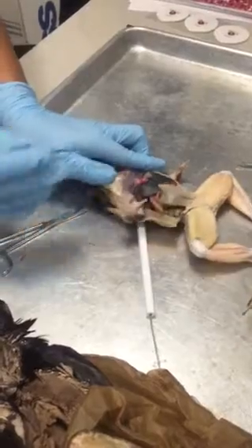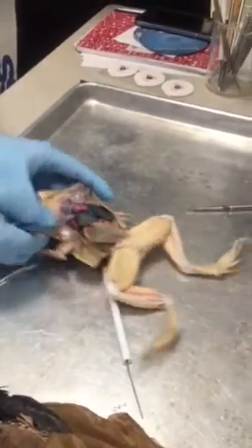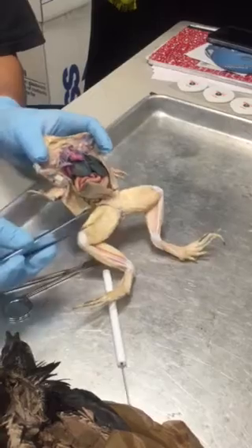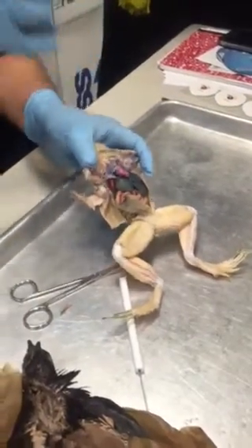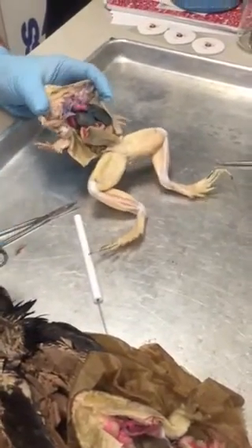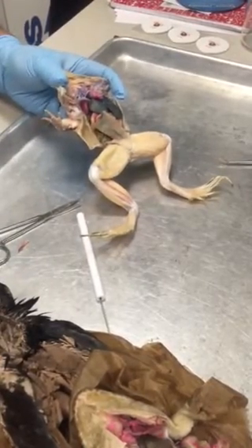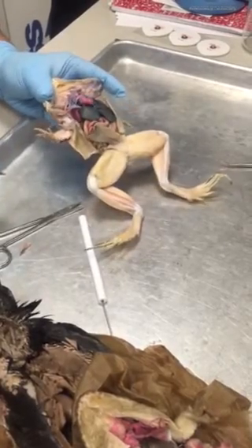Okay, so the blood from the system will return to the heart from the lungs and the skin where it's oxygenated, and it will go into the left atrium, and then it will flow back into the ventricle. So that newly oxygenated blood is now mixing with the deoxygenated blood in the ventricle. And if you're curious, you can cut up through the heart, but you'll notice that there's no separation between the ventricle sides. So there's a lot of mixing of blood.